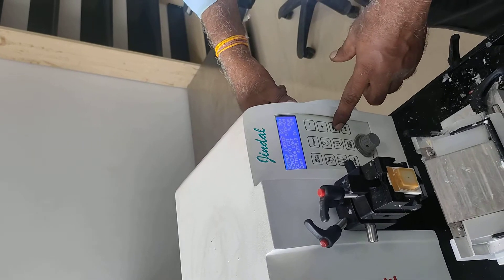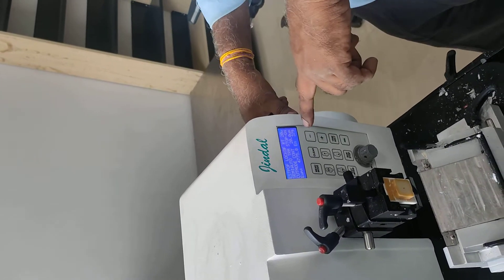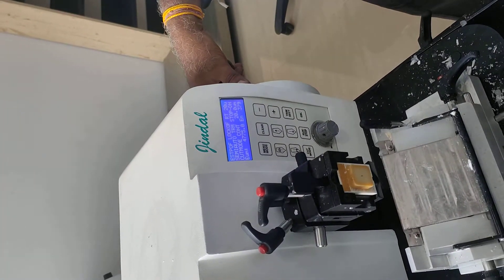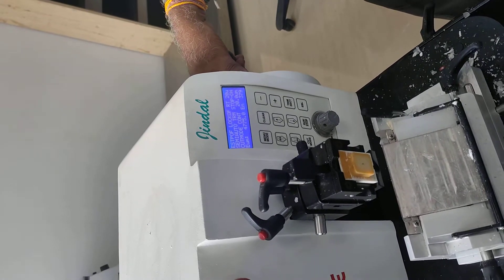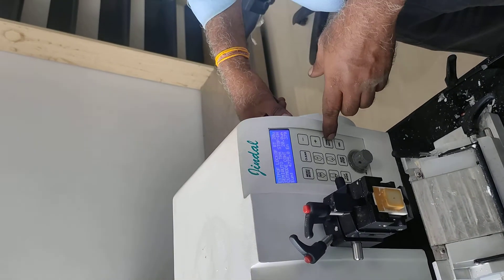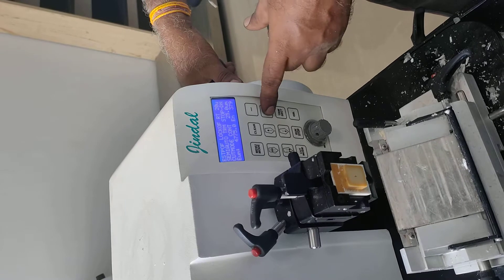So, the Trim — as you select it — the setting goes from 5 microns to 20 microns. We can adjust it. Suppose that we have made a lot of small blocks, or we have a lot of tissue that we have to cut, or in some cases we have to balance the chips. So what do we do? We can increase the trim, plus or minus.